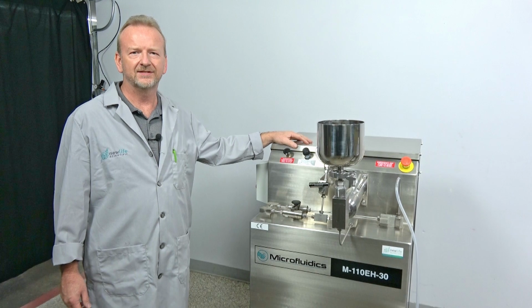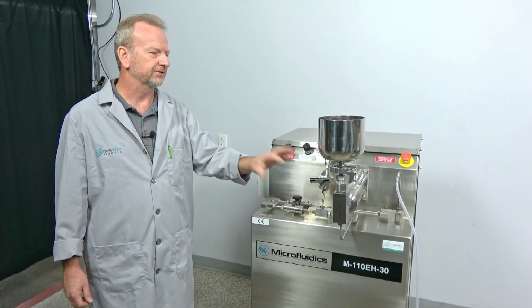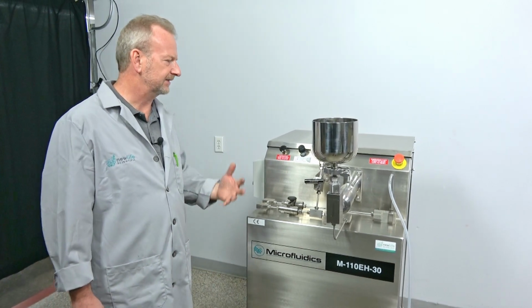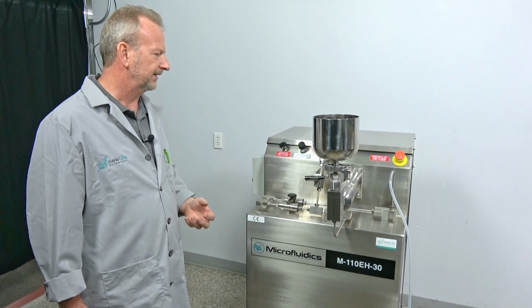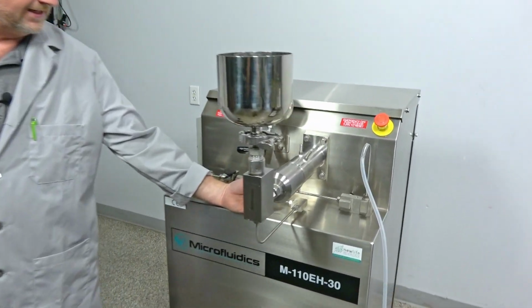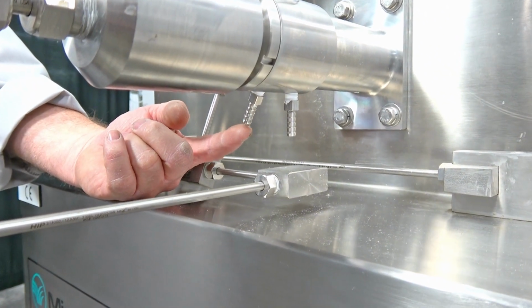Hi, I'm Rich with New Life Scientific, and today I'm going to shoot a video on how to change the plunger seal on this microfluidic system. They make it fairly easy to do, so that if you're running production, especially on a machine like this one, and all of a sudden you start getting drips from this port down here, then that means you've got a blown plunger seal.